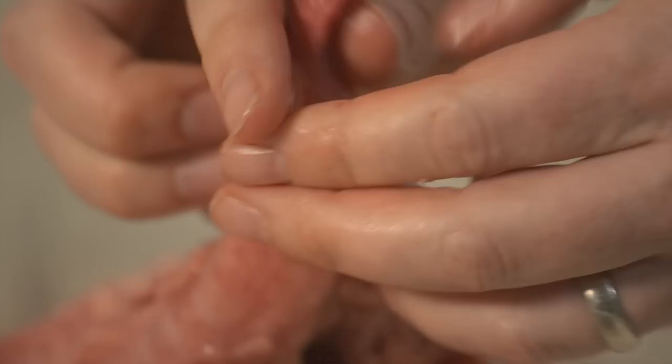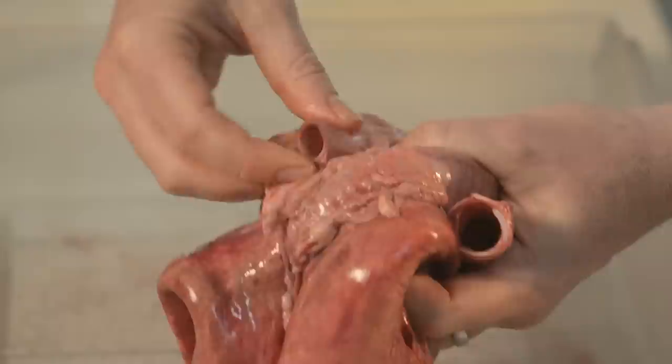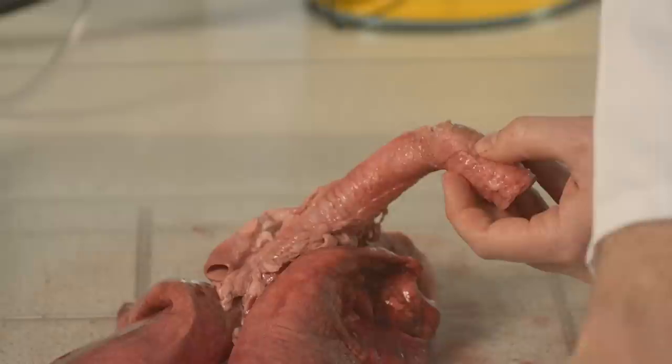So that's the cartilage and the pink is connective tissue. In contrast, there's an artery here. And this artery, I can squash and close. And it's got a very muscular wall. It's not held open. And that's because in real life, this will have blood, a liquid flowing through it. Whereas the trachea has evolved to be held open.